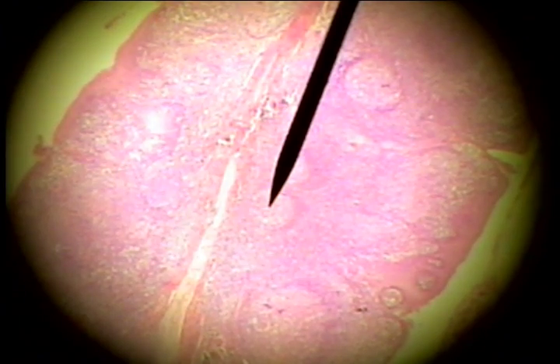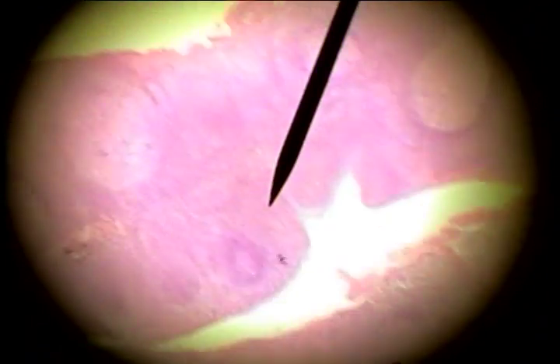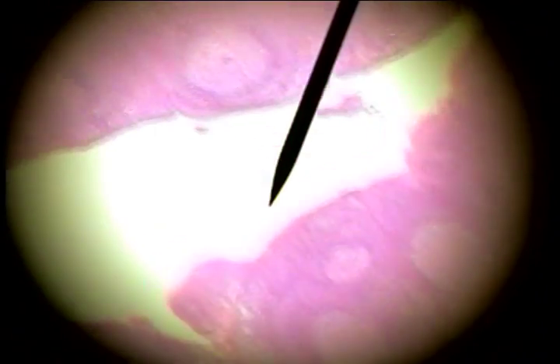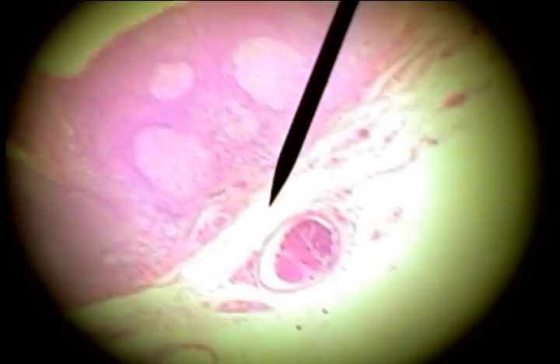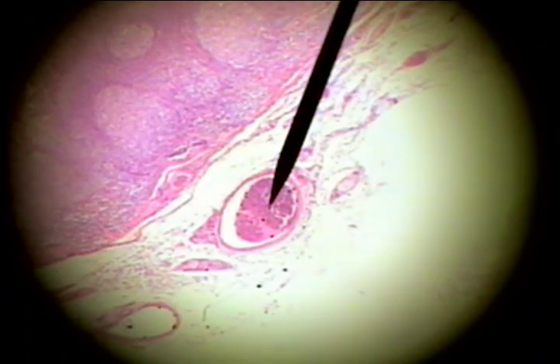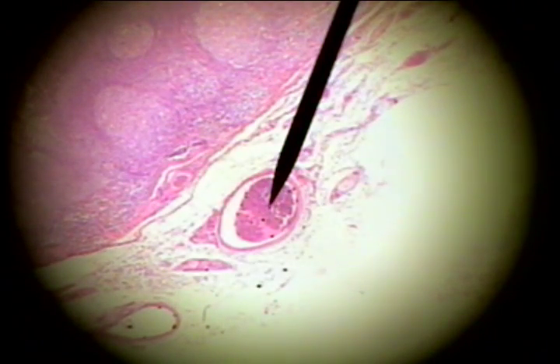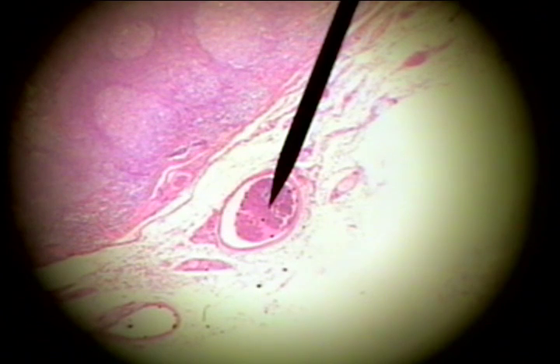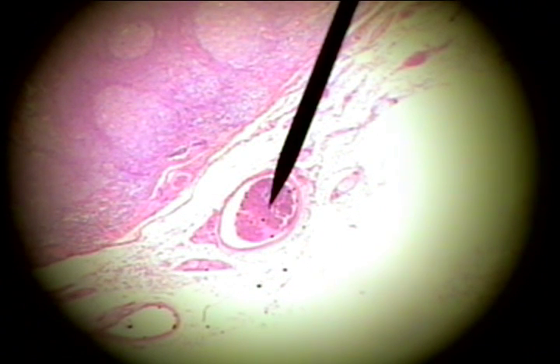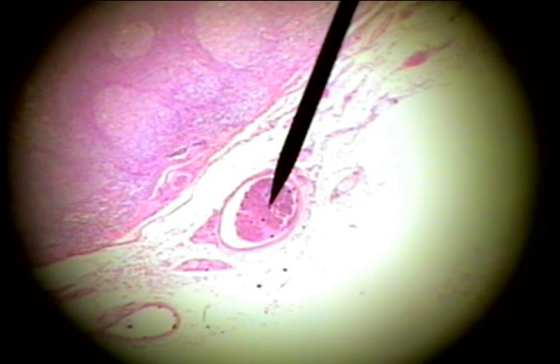There are probably also some blood vessels in here. If we scanned around, we would see blood vessels. There's one there associated with this immune organ tissue.